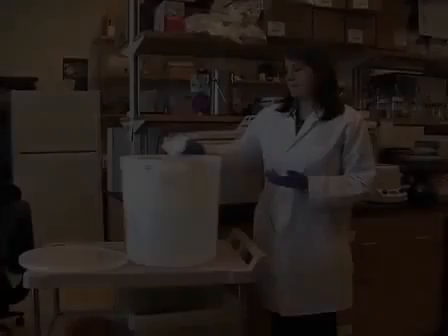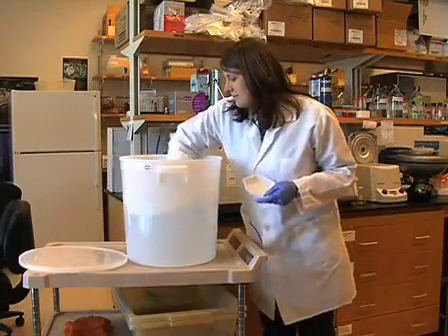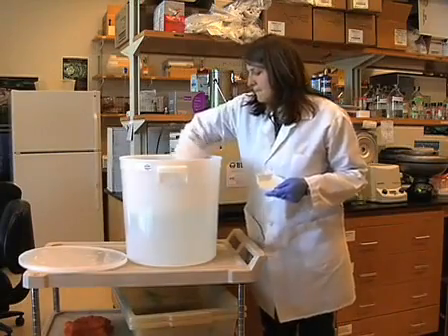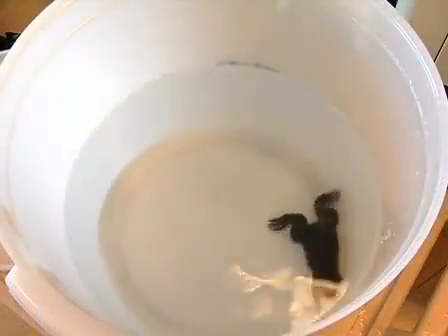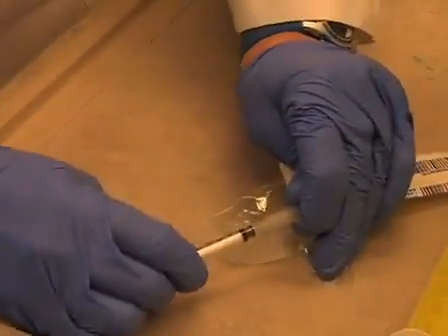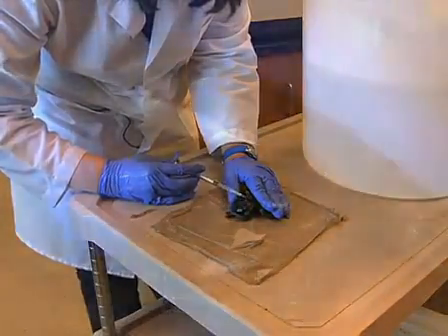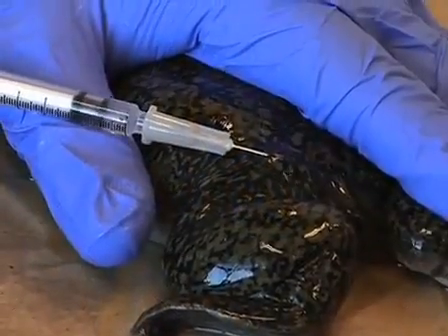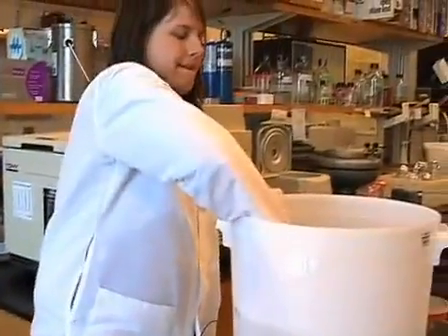To produce eggs, mature female frogs are first primed with pregnant mare serum gonadotropin. To begin the priming procedure, prepare a tank containing 100 millimolar sodium chloride to house frogs after injection. Primed frogs should be kept at a density of approximately 1 frog per liter. Optimal egg production is maintained by housing frogs at 18 degrees Celsius. Using a 27-gauge needle attached to a 1 ml syringe, inject frogs subcutaneously into the dorsal lymph sac with 0.5 ml of 200 units per ml pregnant mare serum gonadotropin. Return primed frogs to the tank containing 100 millimolar sodium chloride.